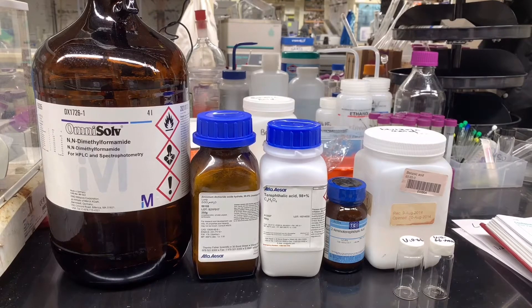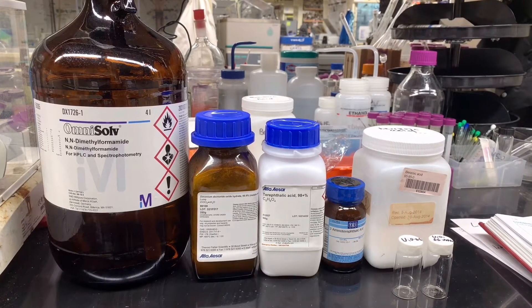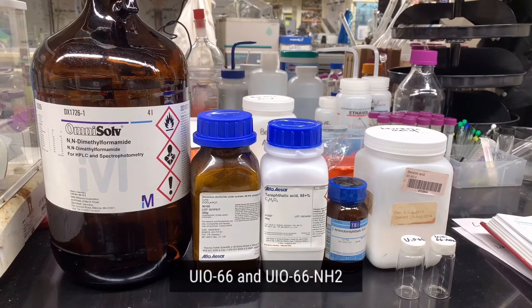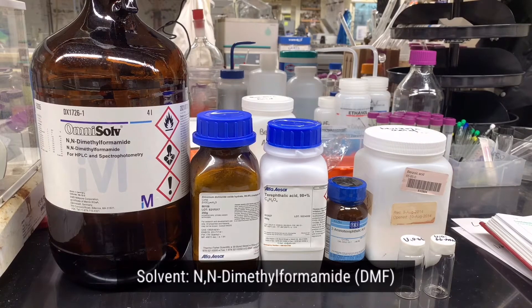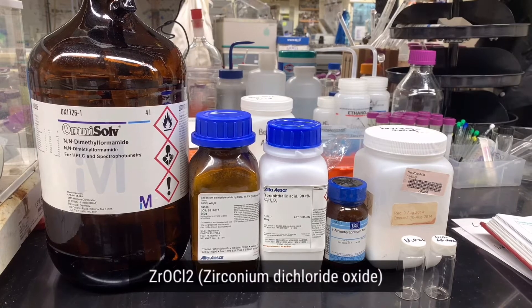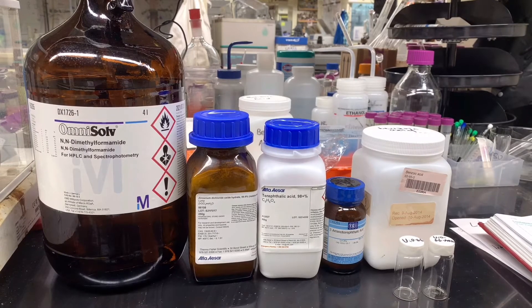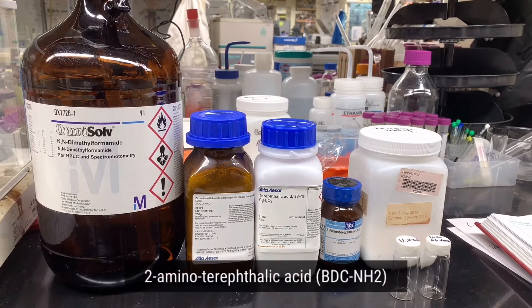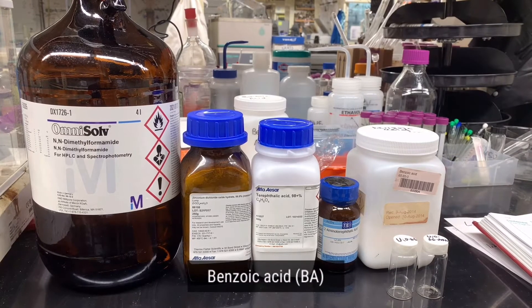Today we will talk about how to synthesize two zirconium-based metal-organic frameworks, UiO-66 and UiO-66 with amino function group. We will use dimethylformamide or DMF as our organic solvent and zirconium dichloride oxide as our metal source. For the organic ligands, we will use terephthalic acid and 2-amino terephthalic acid separately.